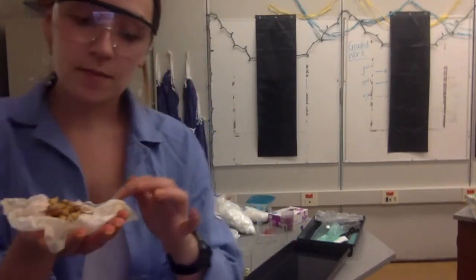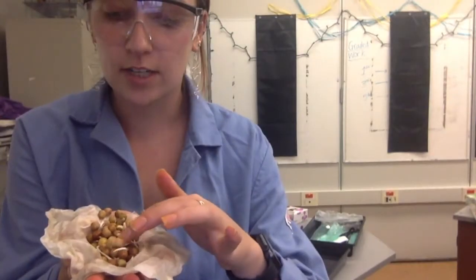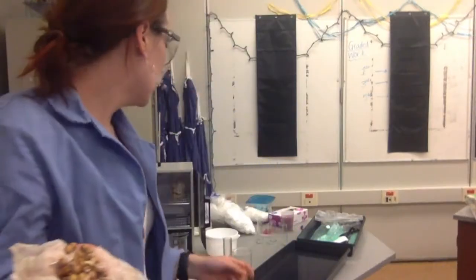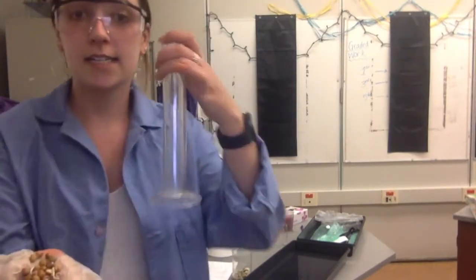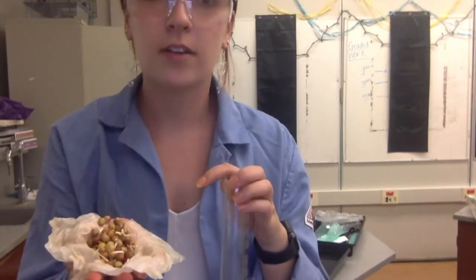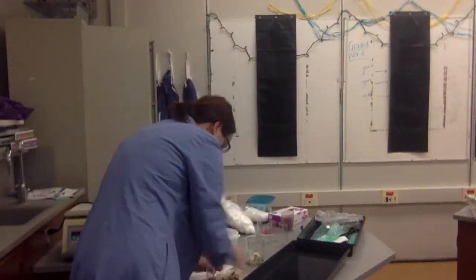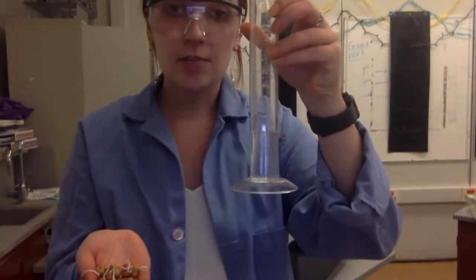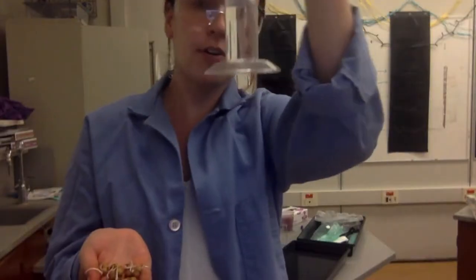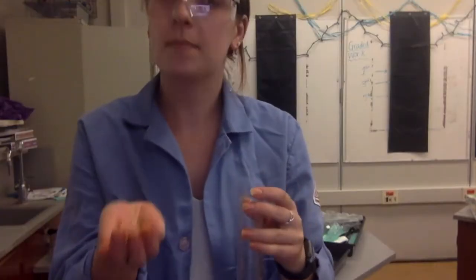We have peas as well as mung beans. I'm going to start by finding 20 germinating peas — ones that are starting to sprout — and I'm going to take their volume using a graduated cylinder and properties of displacement to determine the volume. I have my 20 germinating peas and my graduated cylinder filled with 30 milliliters of water. I'm going to place these into the cylinder to determine the volume.